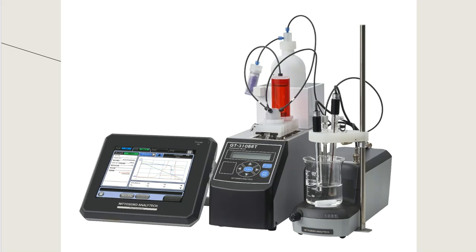And it automates the process. And under the right kind of add-on features, we can even automate it more, so that it can run all day long and titrate sample after sample after sample, and I do not have to be there to do it or touch a beaker or do anything at all until it gets finished. So this is just an example of a titrator.